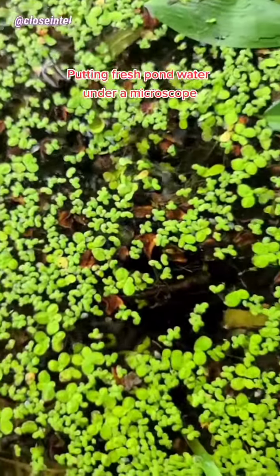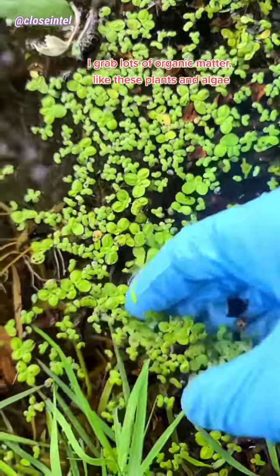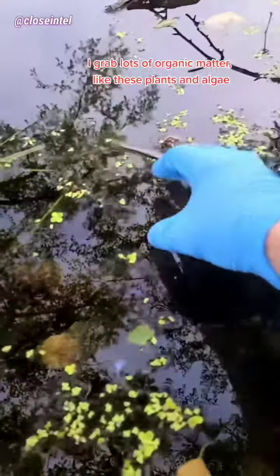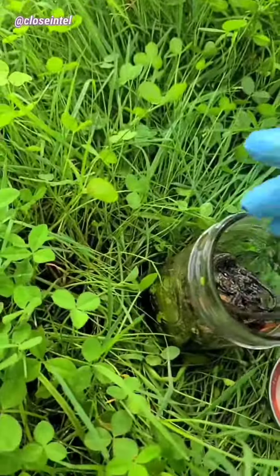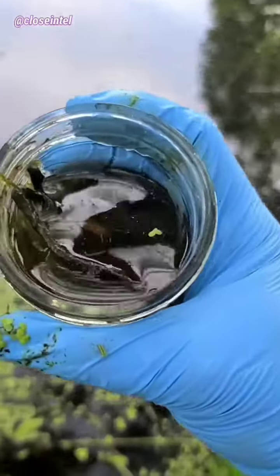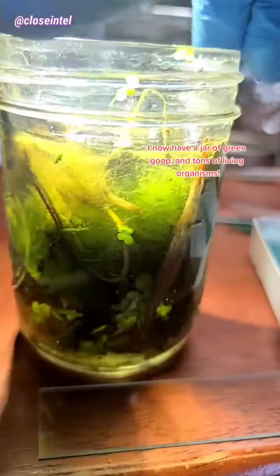Putting fresh pond water under a microscope. I grab lots of organic matter, like these plants and algae. Anything alive and decaying like leaves will work too. Got some of the water as well. I now have a jar of green goop and tons of living organisms.